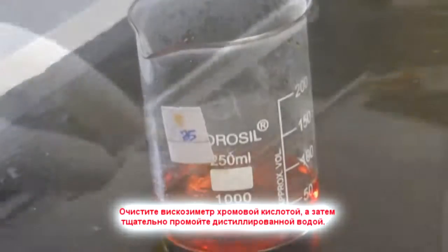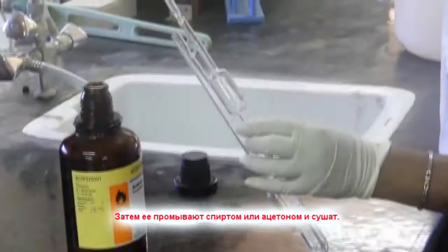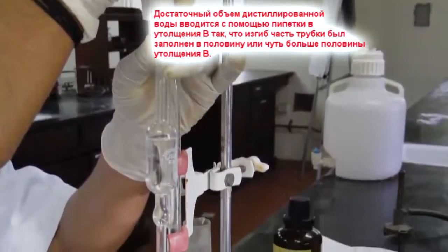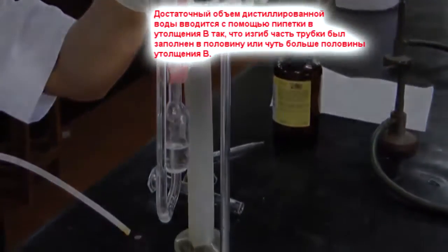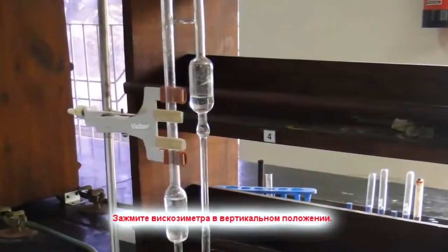Now the procedure. Clean the viscometer with chromic acid and then wash thoroughly with distilled water. It is then washed with alcohol or acetone and dried. A sufficient volume of distilled water is introduced by pipette in bulb B so that the bent portion of the tube and half or a little more than half of bulb B are filled up. Clamp the viscometer in a quite vertical position.